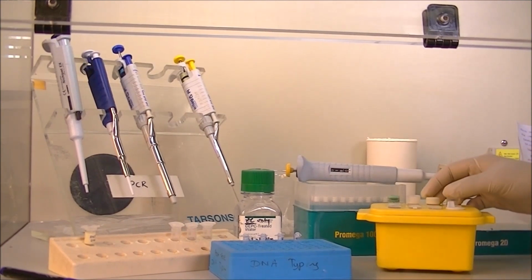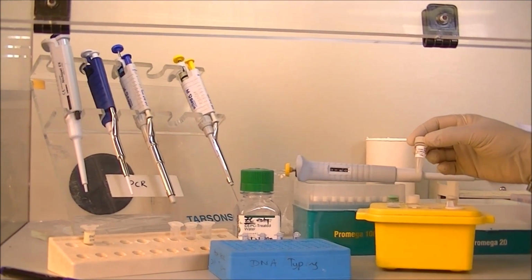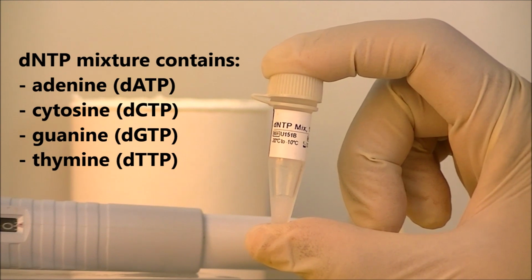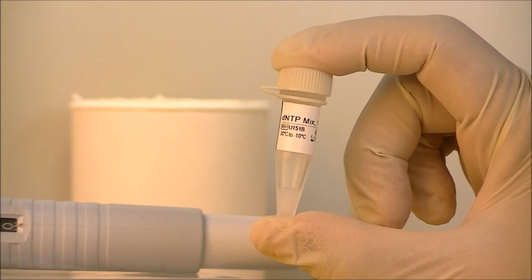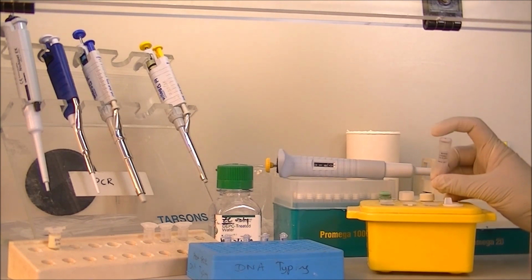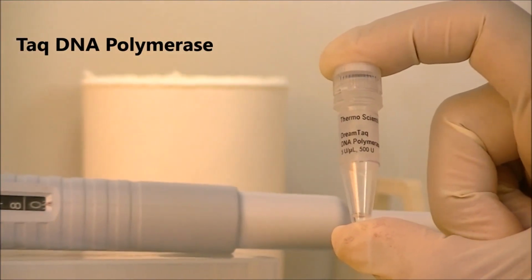The next thing that we are going to add into our reaction mixture is the deoxynucleotide triphosphate mixture, commonly known as dNTPs. This contains a mixture of 4 nucleotides that are needed to synthesize the new DNA molecules during the amplification process. The final component that we are adding into the mixture is the enzyme. This enzyme is known as Taq DNA polymerase.